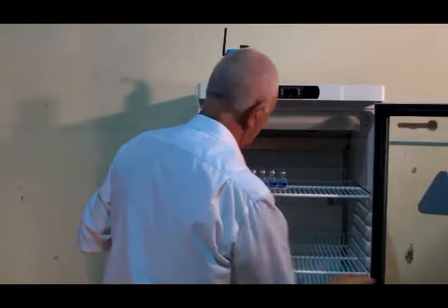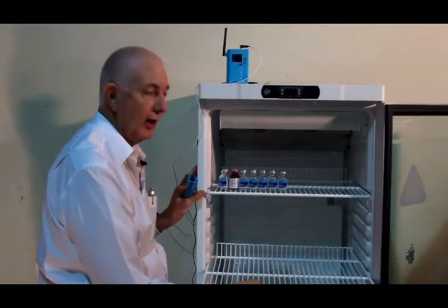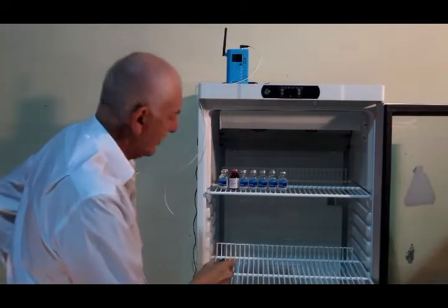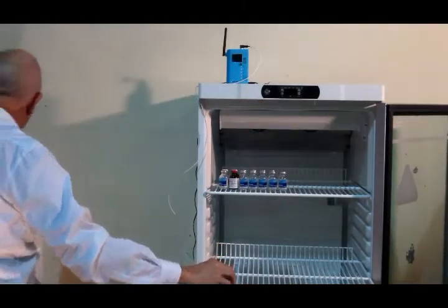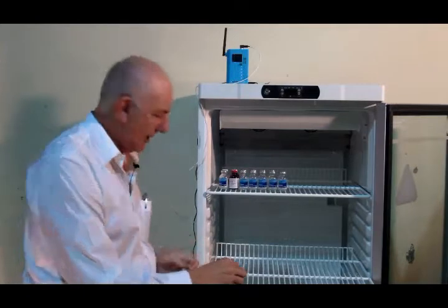Open the fridge. If you can, slide out a shelf. It's very convenient for me because we don't have any vaccines in this particular fridge. Take a cable tie provided.